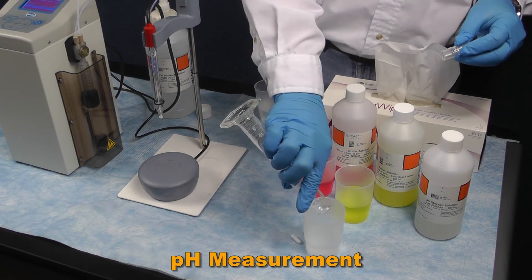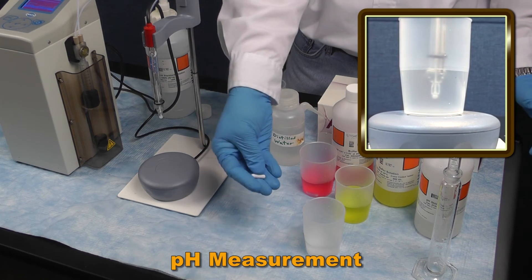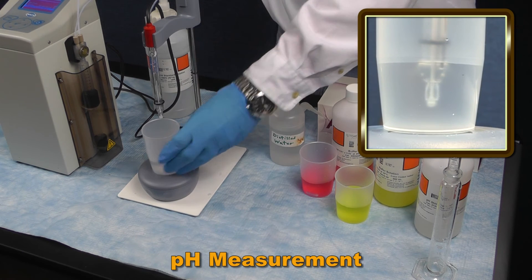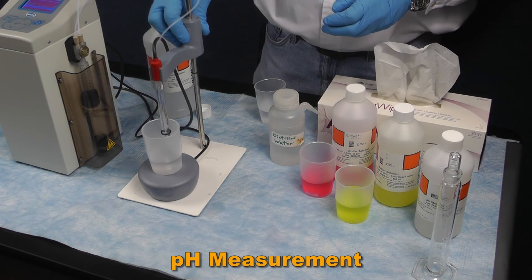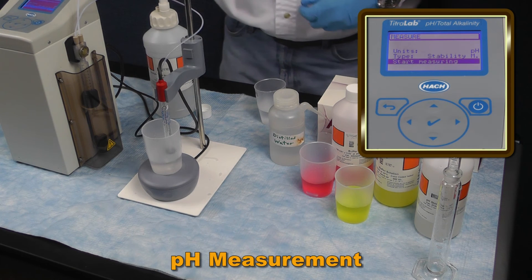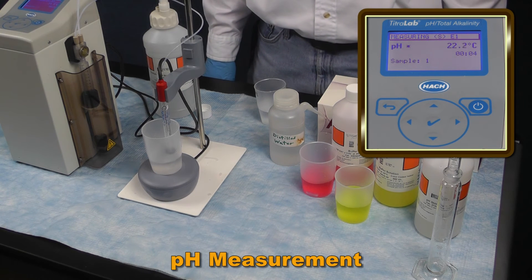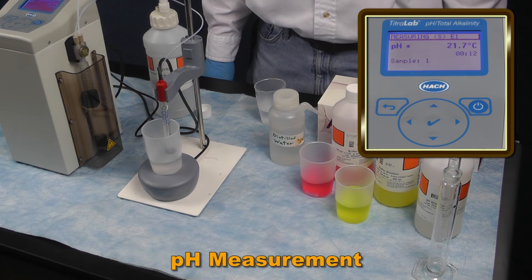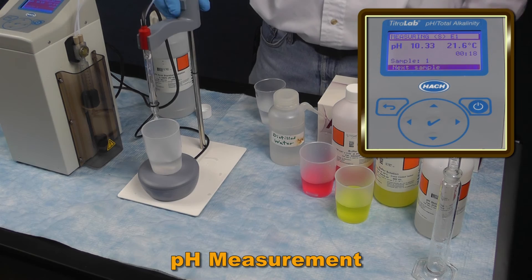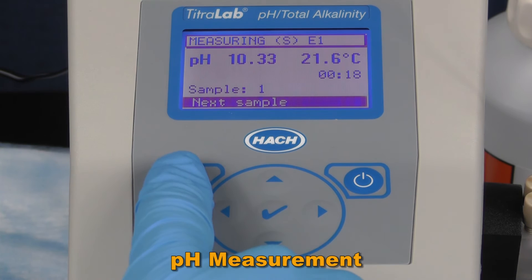Place it under the stand and lower the pH electrode into the sample. Make sure the pH electrode is completely immersed into the sample so the entire glass bulb is under water. On the screen, press the check mark and wait for the measurement to stabilize. The display shows the results after stabilization.